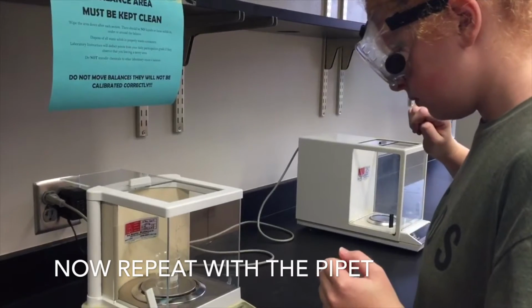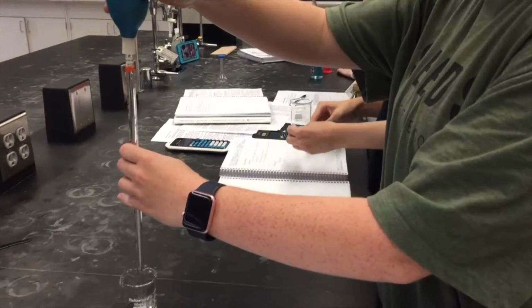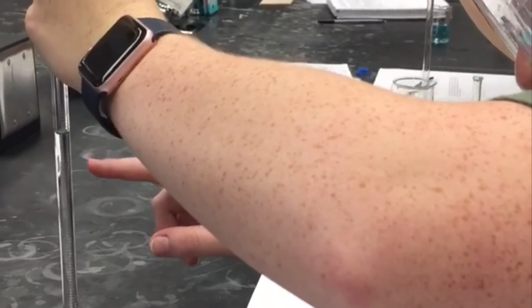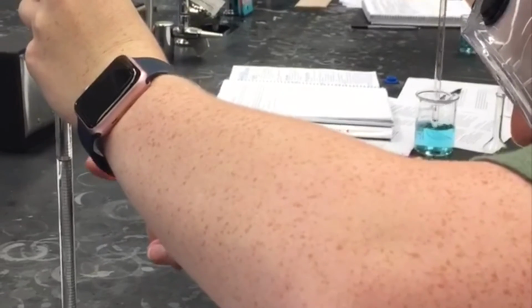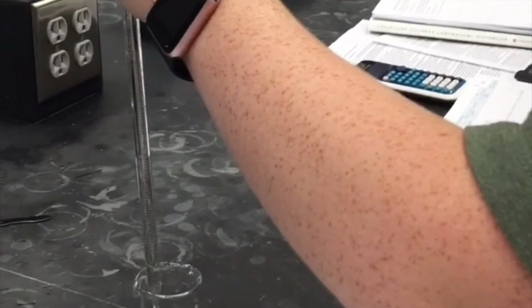You will first start off with a beaker, and then you'll measure the mass of the beaker by itself. Using a different container containing water, draw up the water using a pipette. You can see a meniscus in the pipette like you could see the meniscus in the cylinder, which is why you'll need to read the volume at eye level. Make sure to read the volume by reading the bottom of the meniscus.